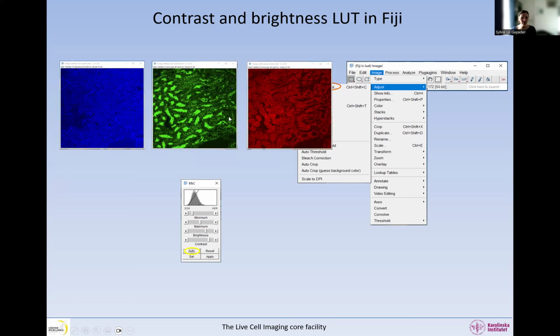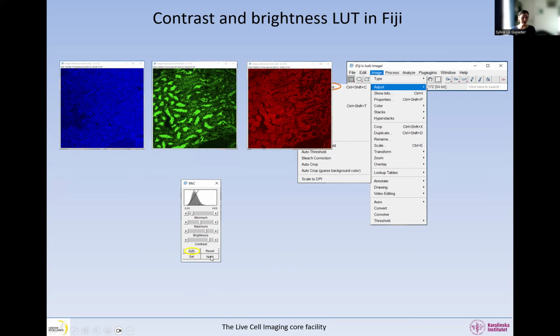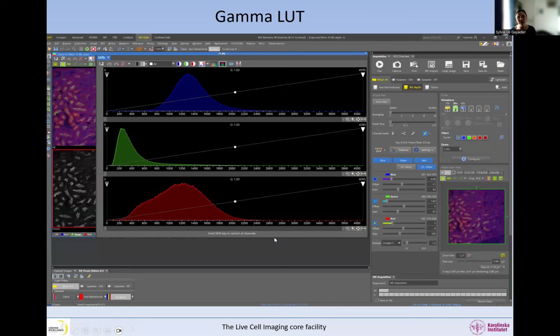So then the images are pushed, and do not press this button Apply, because in Fiji, when you press Apply, it actually modifies the images. So if you want to press Apply, fine, but then you save the images again as a new image, okay? So you should only work on a copy of the original image, and always mention any adjustments in your materials and methods. For example: the brightness and contrast in the images has been adjusted. So it's a very short way to describe that.